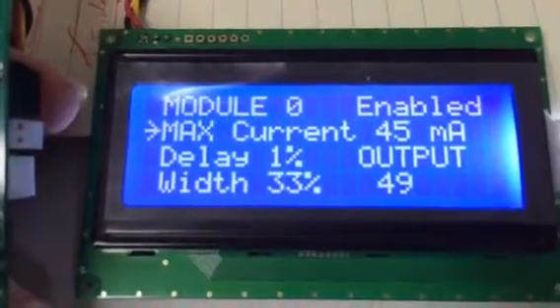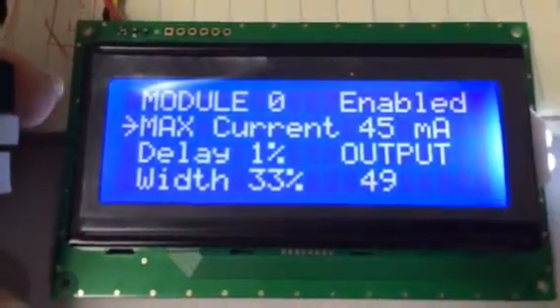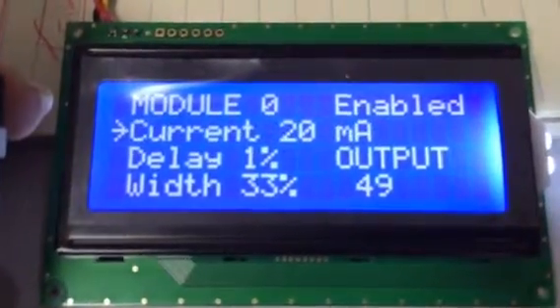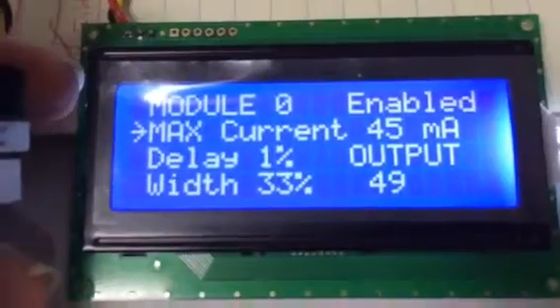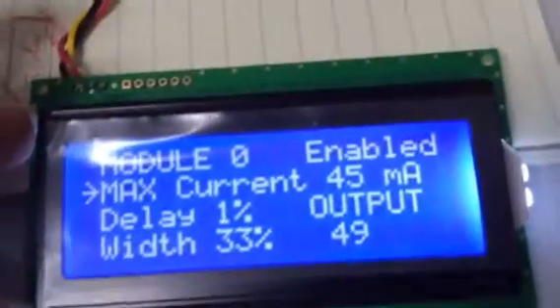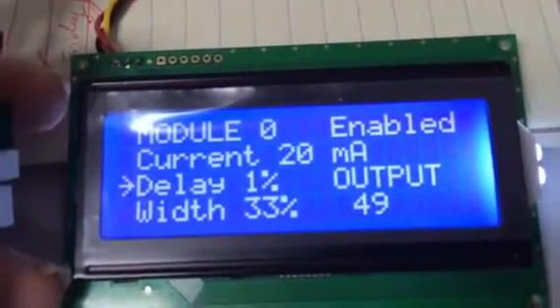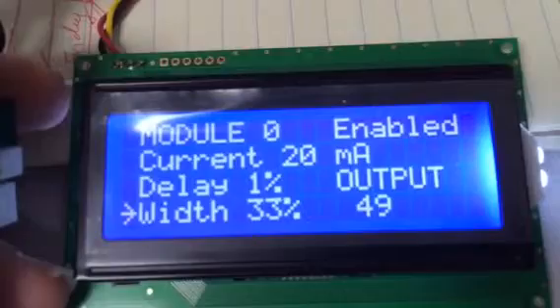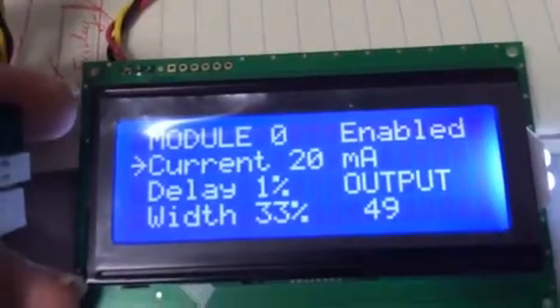You can get out of the maximum current setting mode by hitting up and down again, or if you're in the mode and you change parameter by hitting the setup button, and we go to, for instance, change the delay, that turns off that mode, so we're back to regular operating mode. This is to avoid changing accidentally the current.